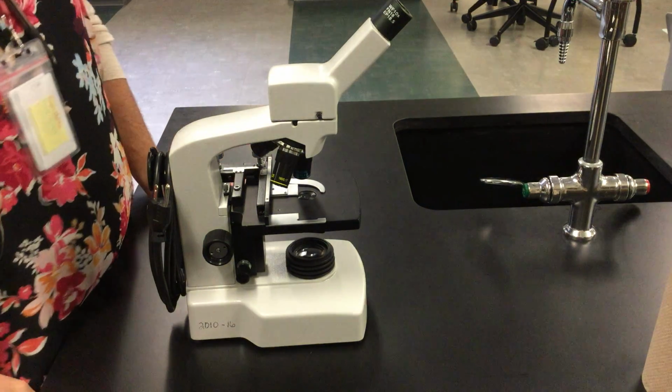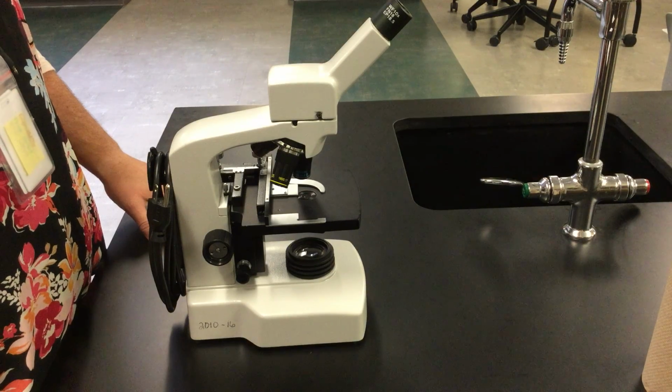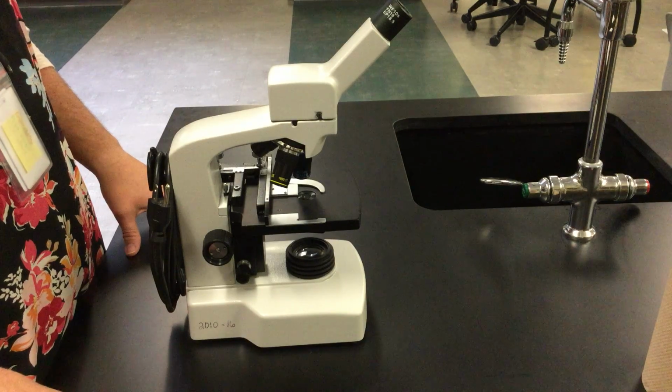In this video, I'm going to be telling you about the different parts of the microscope. This will help you be successful in lab, and it'll also help you on the test next week. You will need to know the different parts of the microscope and their function or their purpose.